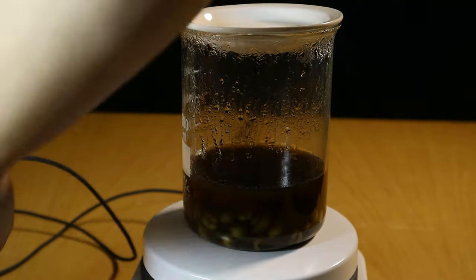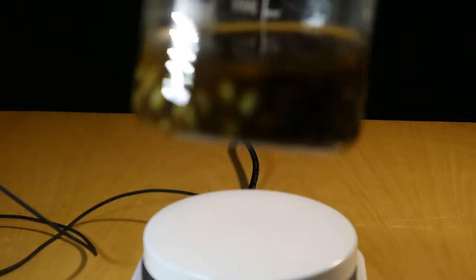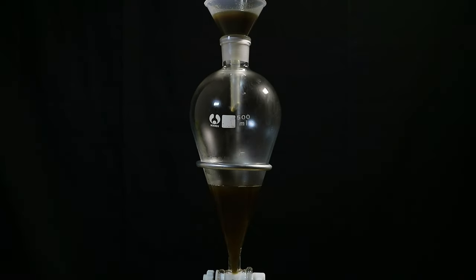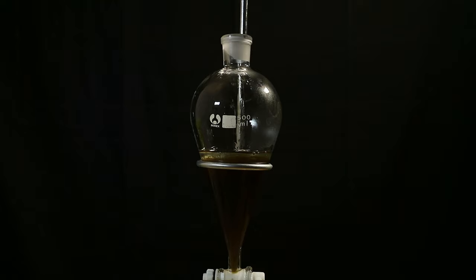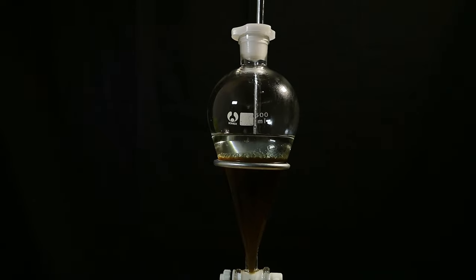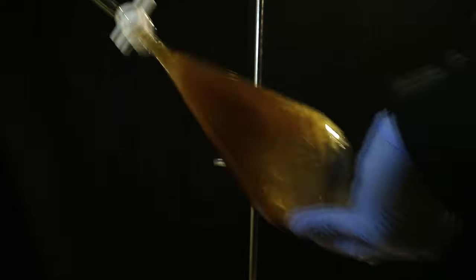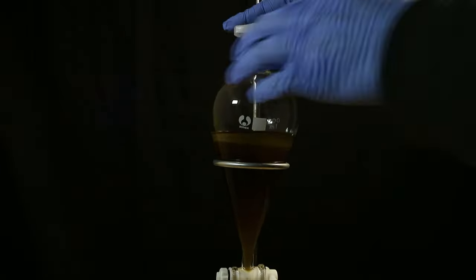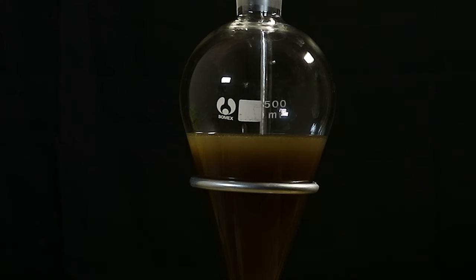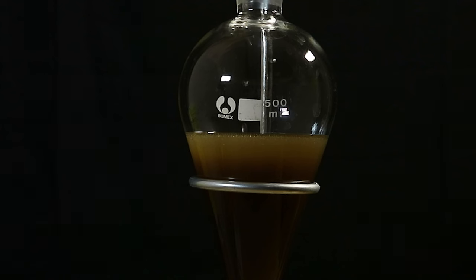Back in the coffee-is-tea timeline, we have been stirring the beans in hot water for a bit over four hours and can now assume we have dissolved the majority of the caffeine into this beautiful black brew. So let's try to move the caffeine out of the aqueous solution by washing it in a separatory funnel with ethyl acetate. Theoretically, caffeine is more soluble in ethyl acetate than in water, so we should be able to move it over to the acetate by shaking the mixture in the funnel. Since I wasn't careful enough, we of course achieved emulsion almost immediately.